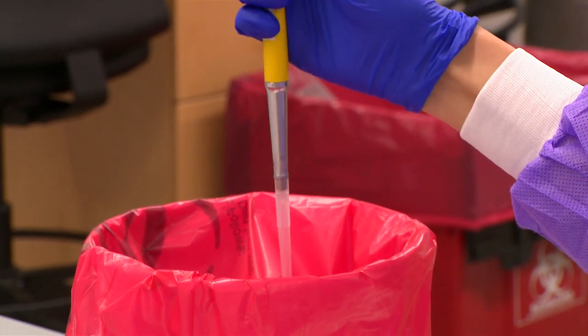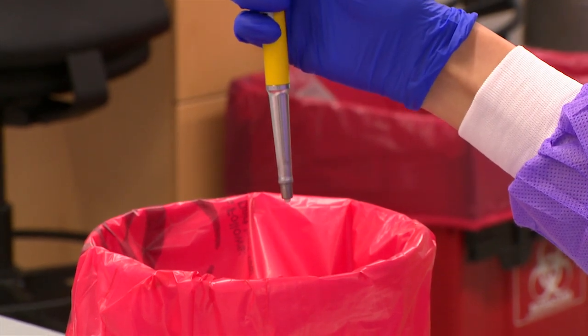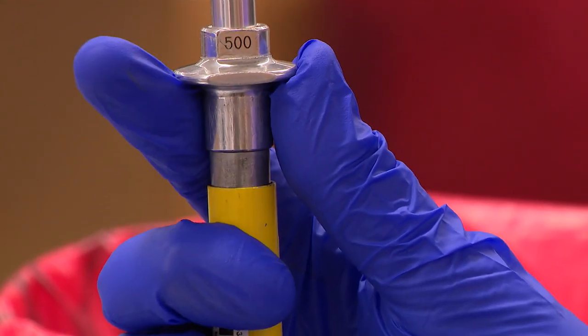Eject the tip into a biohazard container by lifting the tip ejector bonnet.